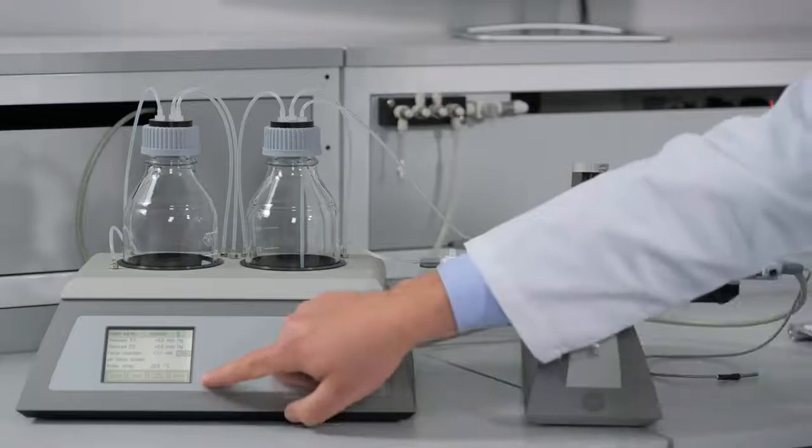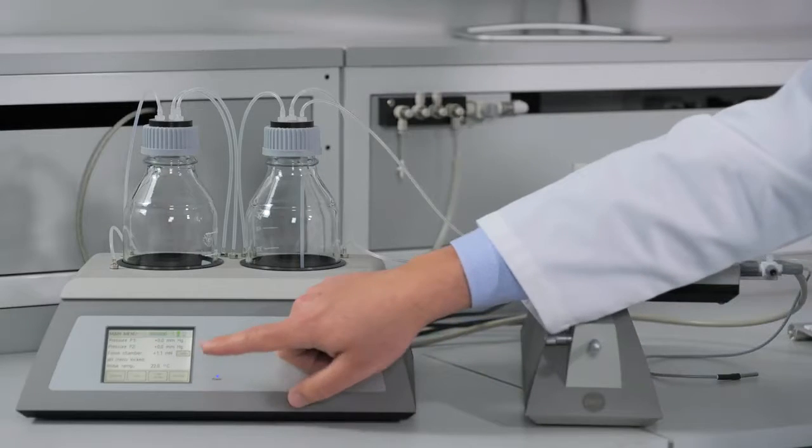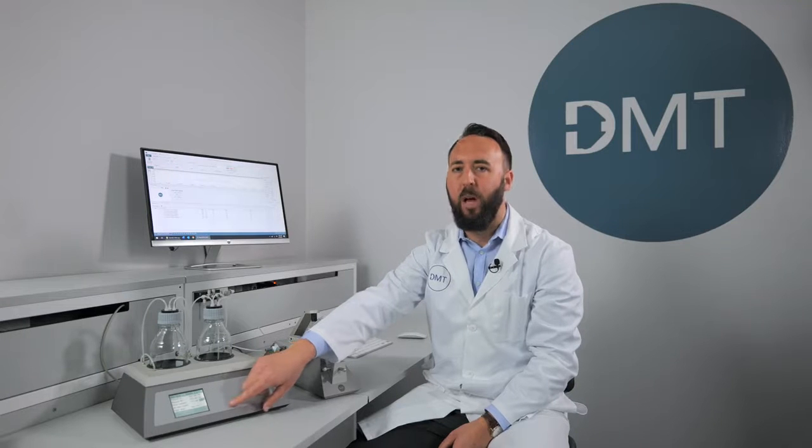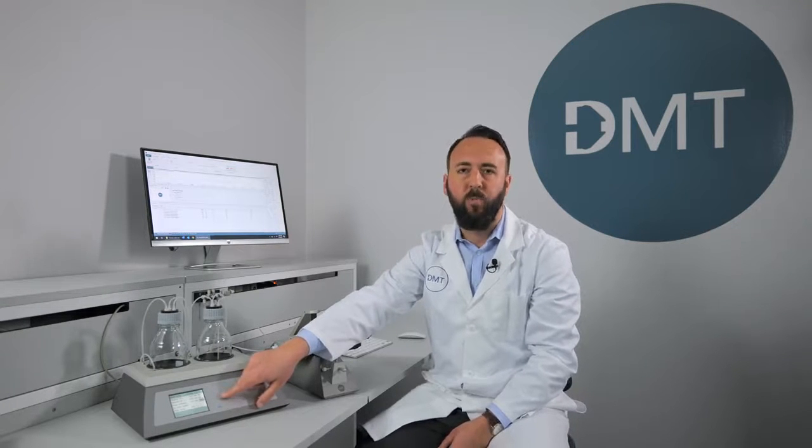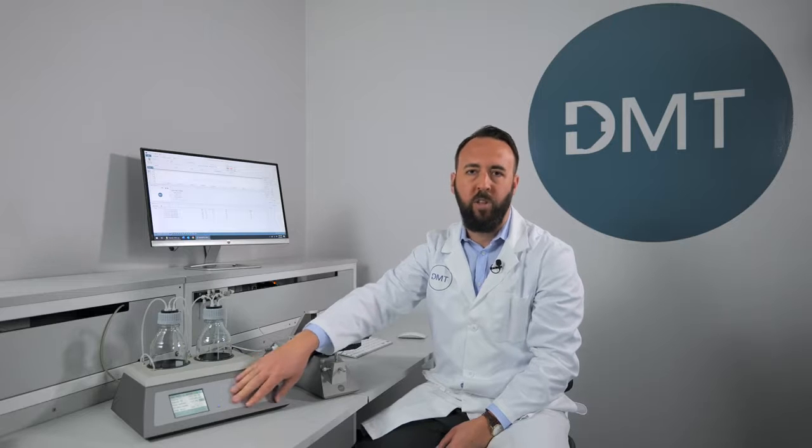When you are navigating the menus on the touchscreen, make sure to just use your fingers and not pens or lab equipment. The screen is also liquid resistant, but if you do spill water or PSS, make sure to clean it up quickly.